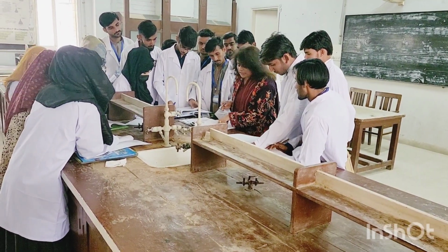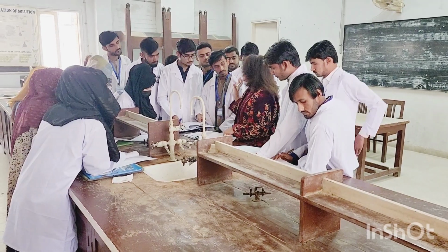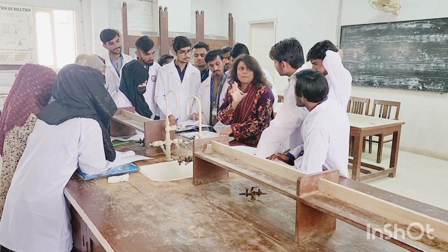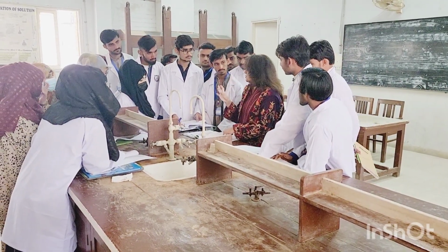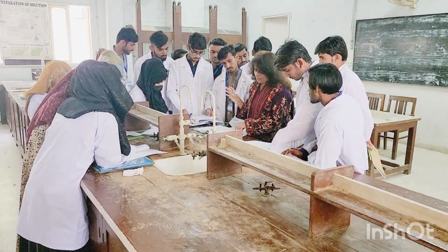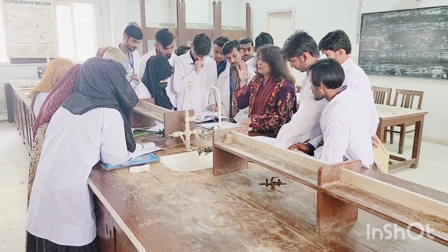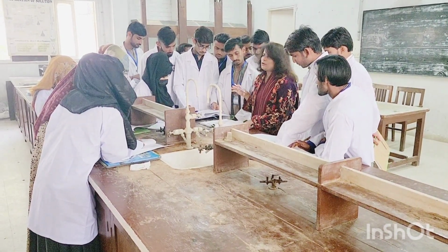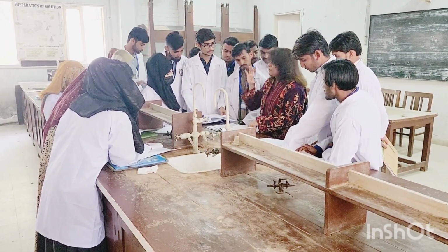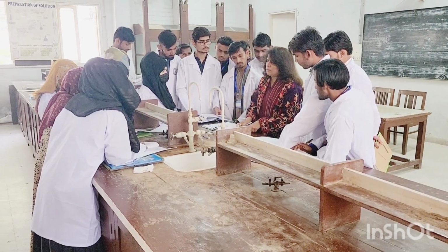Then you will do the unsaturation test, and there are 2 types of unsaturation tests. Whether your compound is a saturated compound or unsaturated. I hope everyone knows what a saturated and unsaturated compound is. So there are 2 tests, that's Baeyer's test and the reaction with bromine water. These 2 tests you are going to do accordingly. When you reach this step, I will tell you. You will use a test tube for both tests. Okay? And these tests will tell you about the unsaturation.